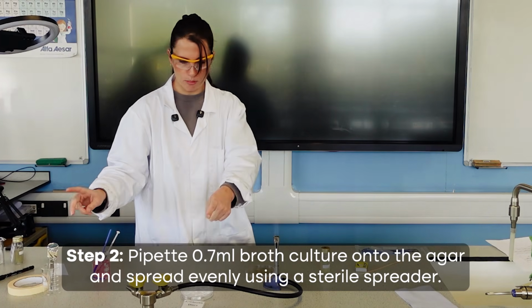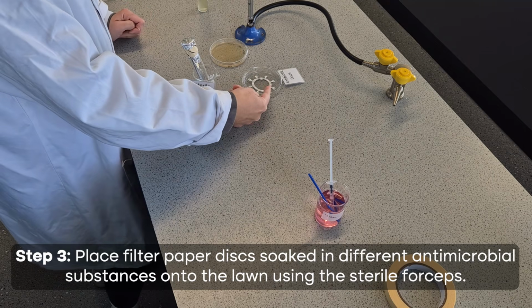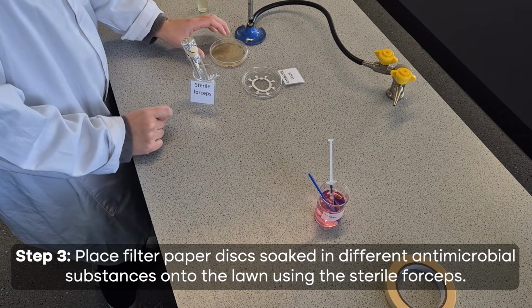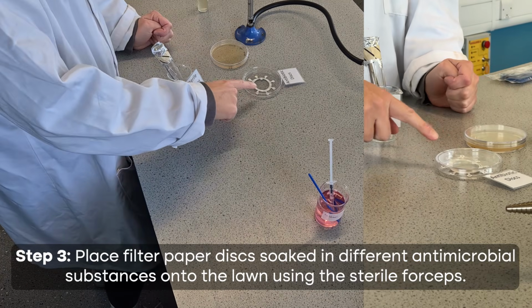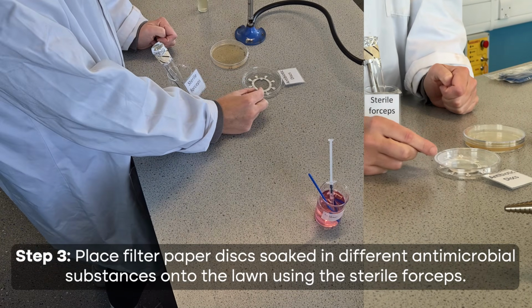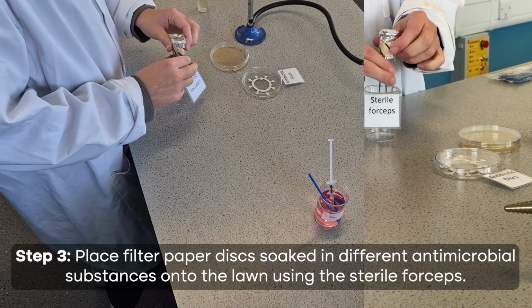That's the last step, just putting the antibiotic disc on. Final step then is we need to put the antibiotic discs onto our plate. And this is where we're going to use our sterile forceps. Now you might not have an entire ring like I have here. They might just have individual pieces that they pick up and place on. But I've got the entire ring.